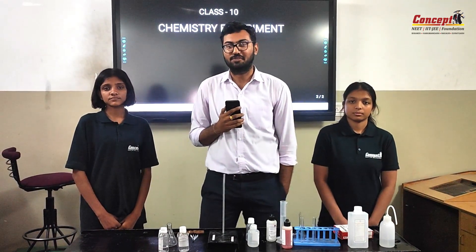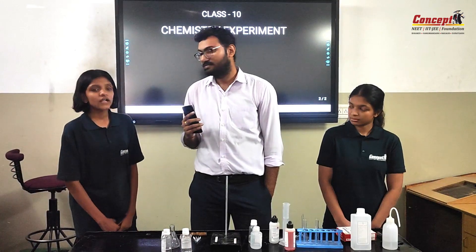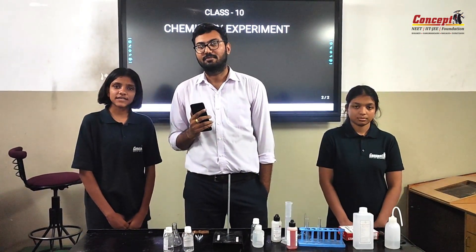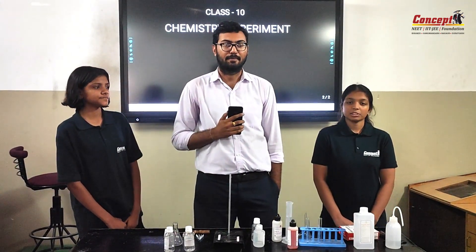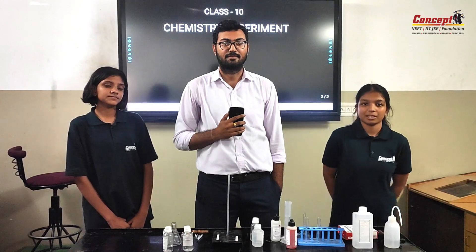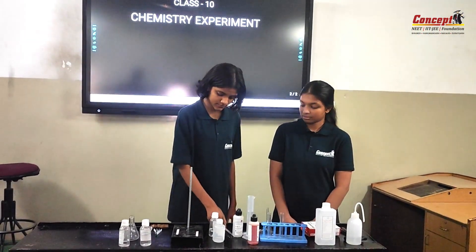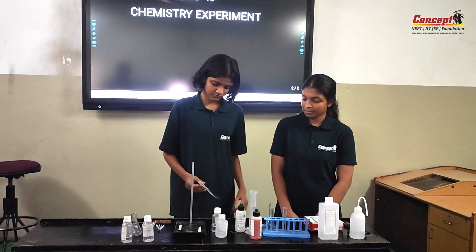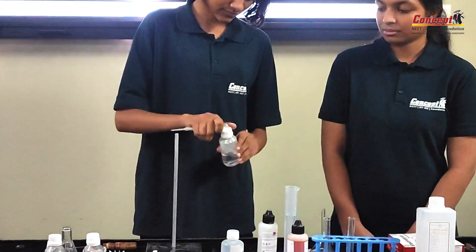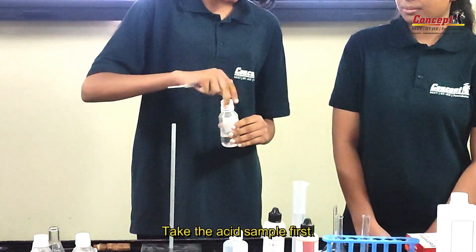Students, please introduce yourself. Hello, my name is Monica from class 10. My name is Shadi from class 10. Now let's start the experiment — student, take the acid sample first.